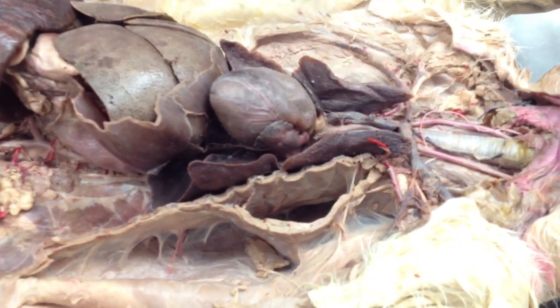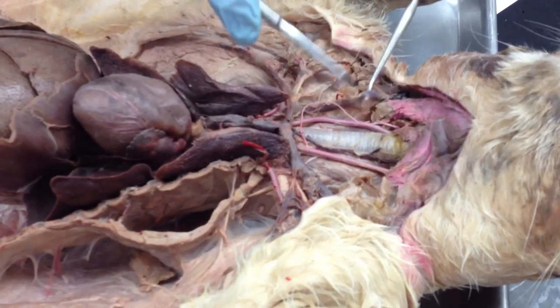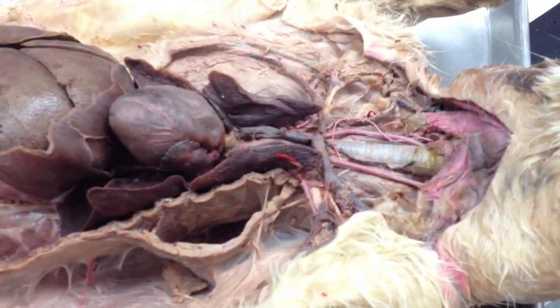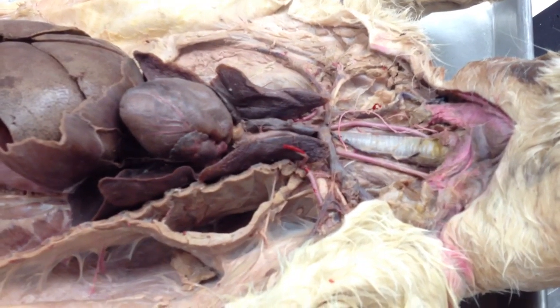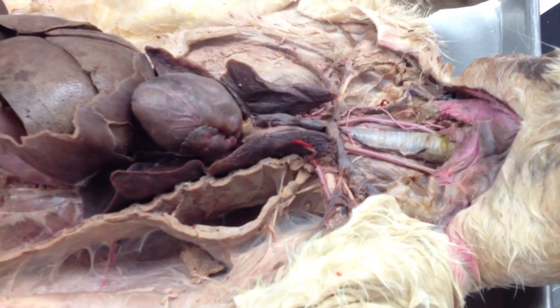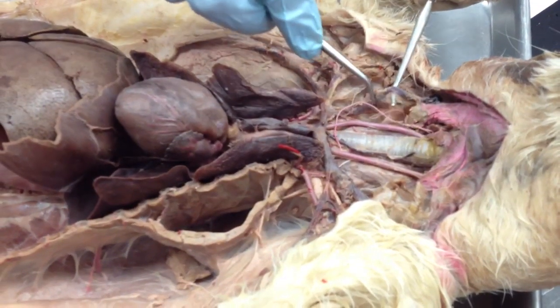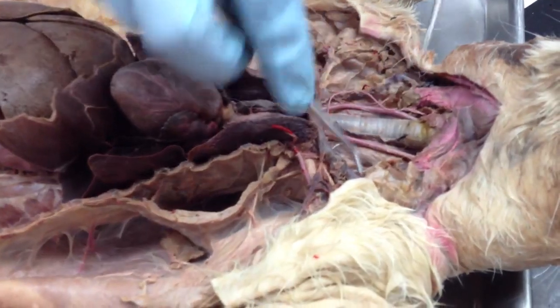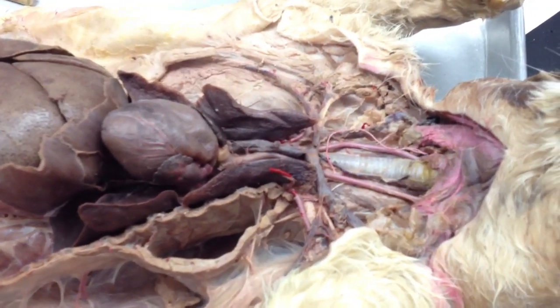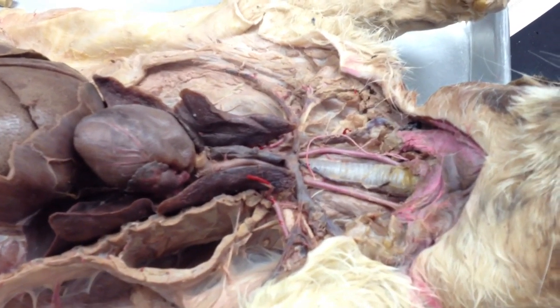As far as the jugular goes, I can't get a straight answer, and I don't really know. So if I have this pinned right here, or that pinned right there, and you answer common jugular vein or jugular vein, you get credit for it. I mean, there's an external jugular vein and internal. Internal we can never see because the latex never really highlights it well. I'm still not entirely sure if that's external and there's common somewhere else, so I'm just going to have you guys answer common jugular vein or jugular vein.